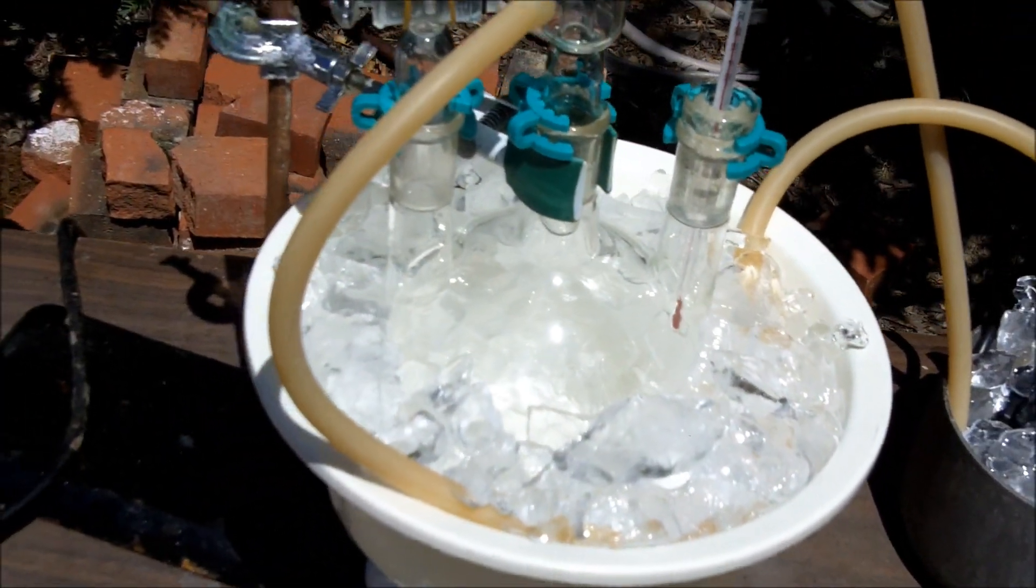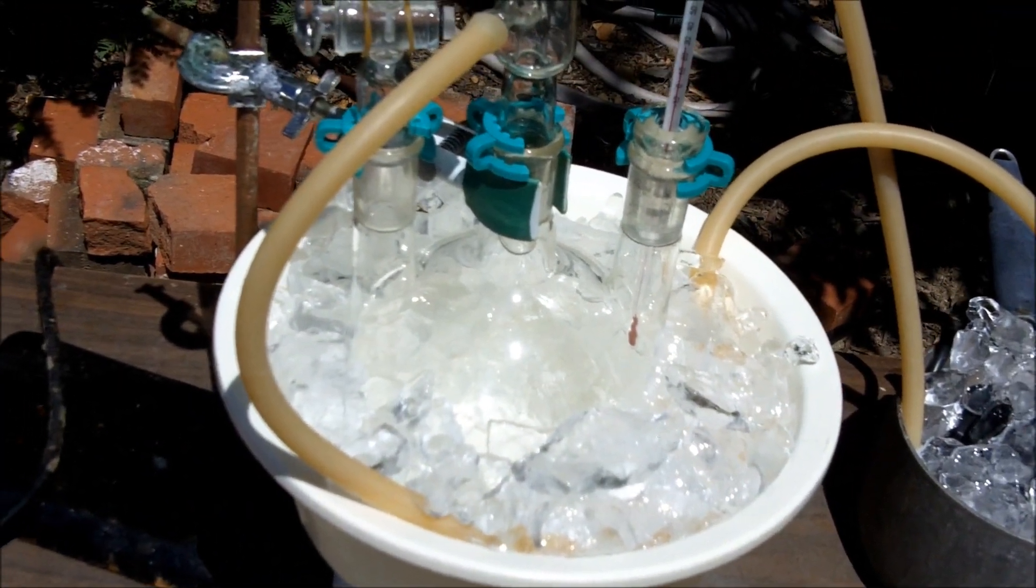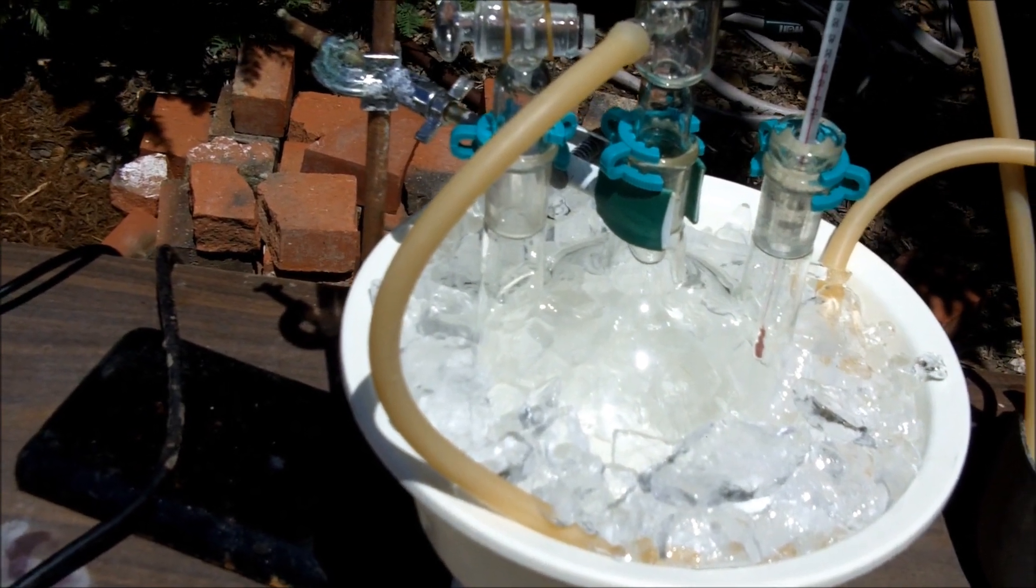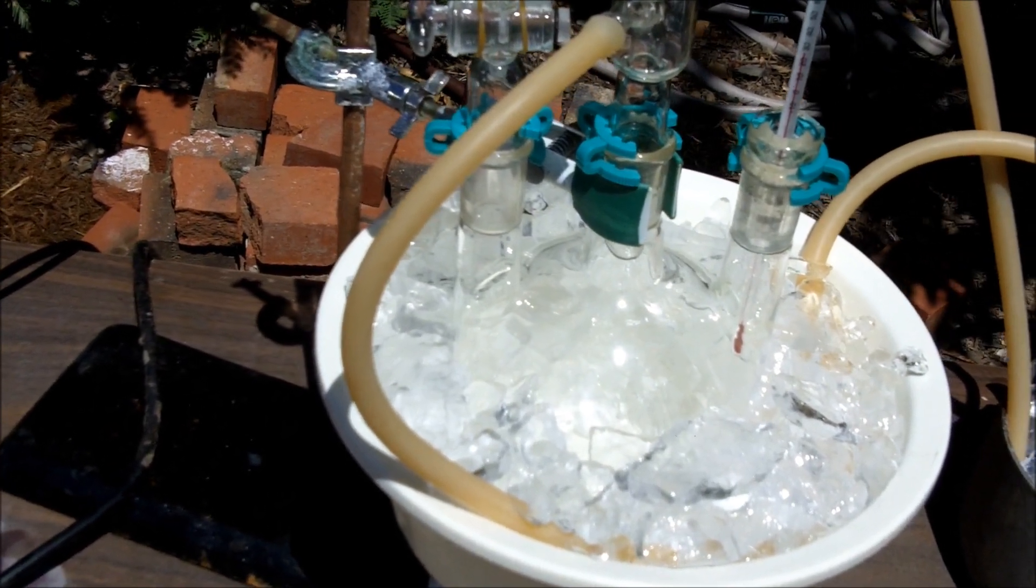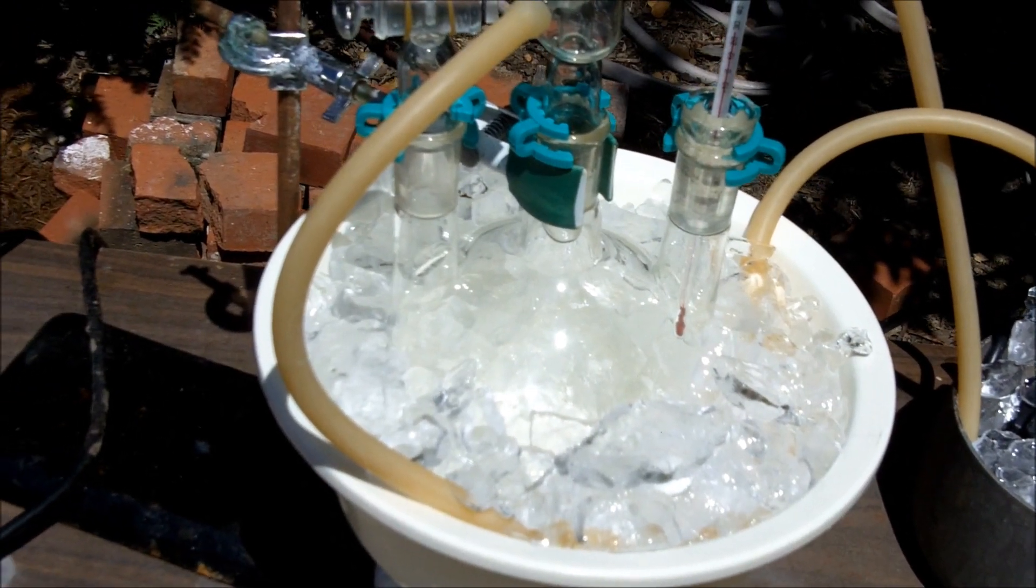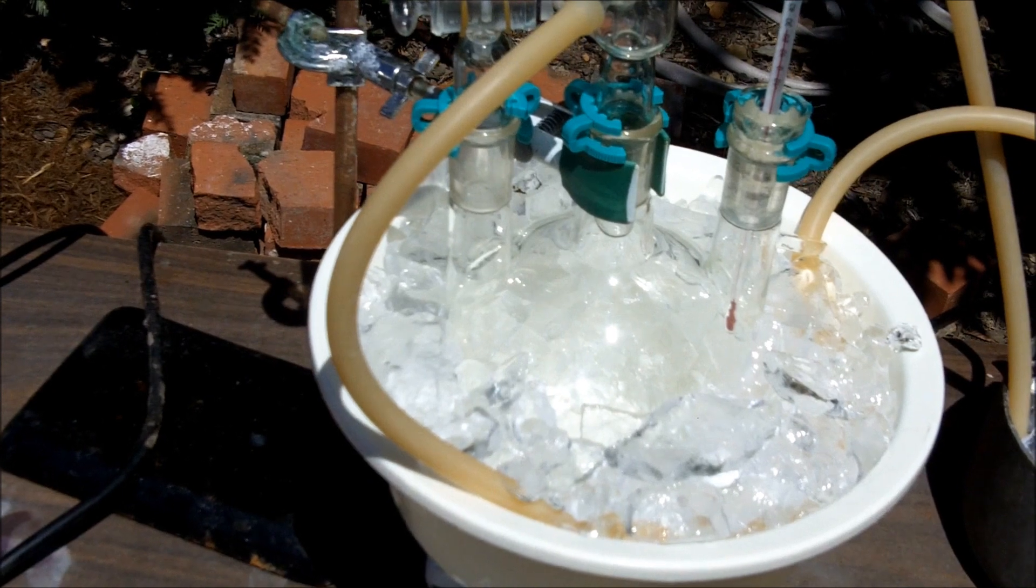How this reaction works is I'm going to add calcium hypochlorite to that flask and some water, and then I'm going to slowly add acetone to the addition funnel. This reaction is extremely exothermic, so the ice is there to help cool it down, and reflux is going to be necessary.